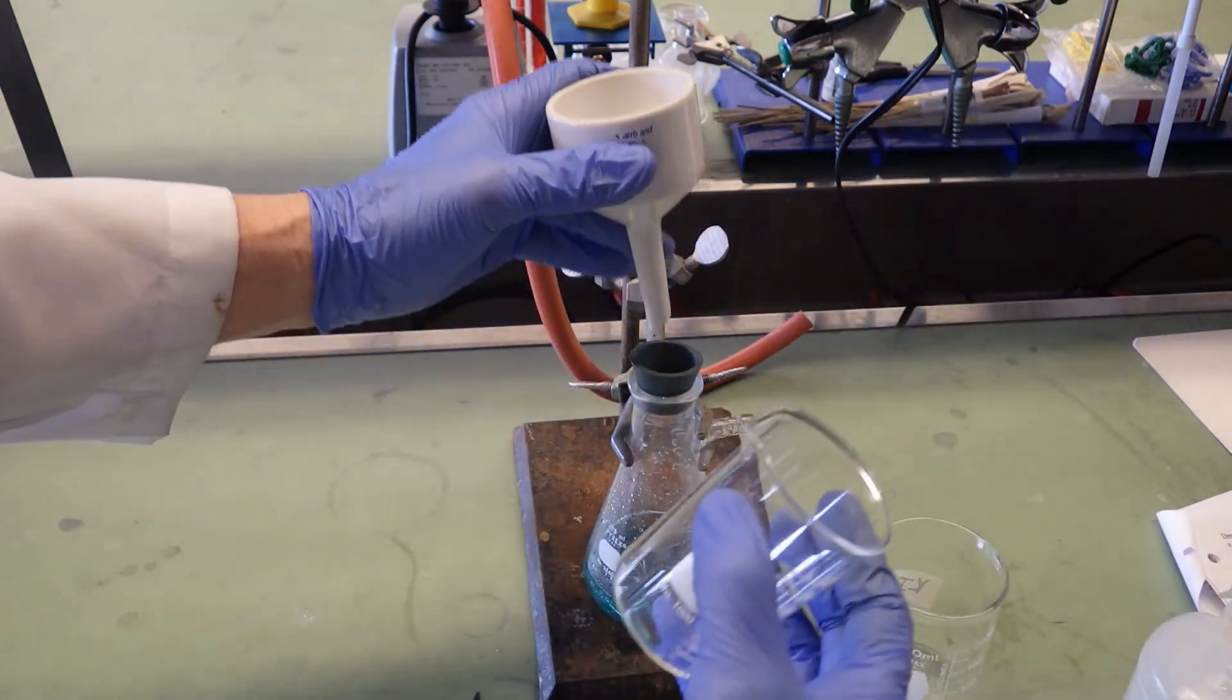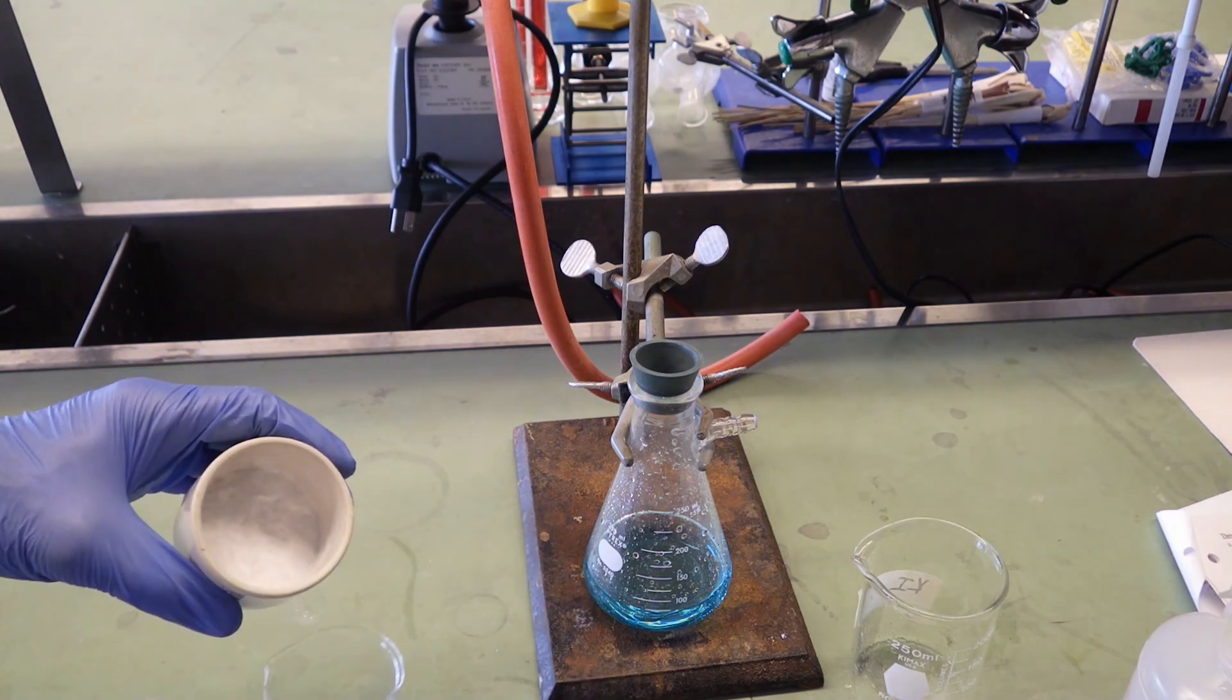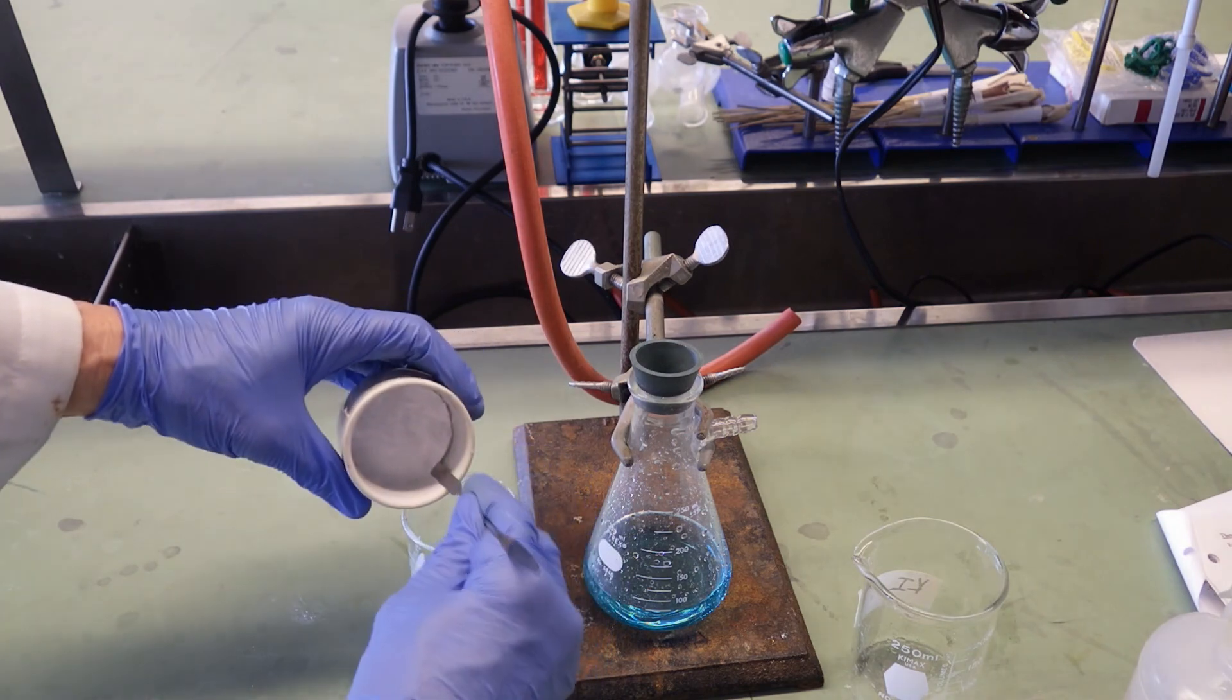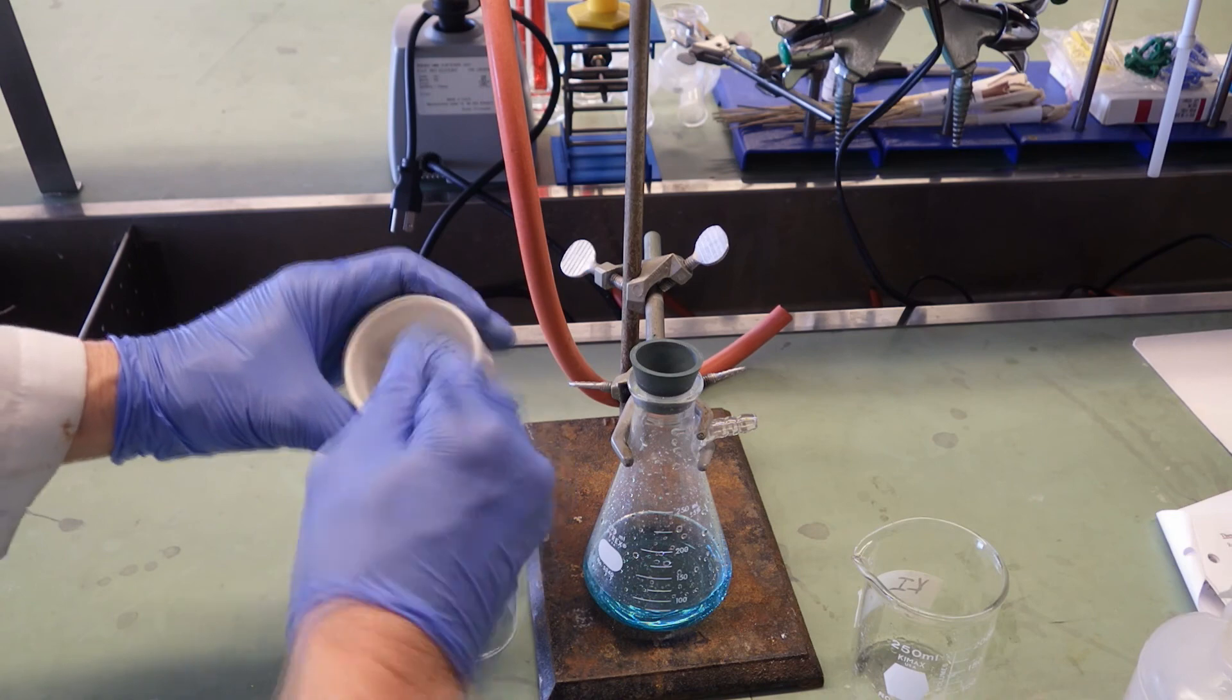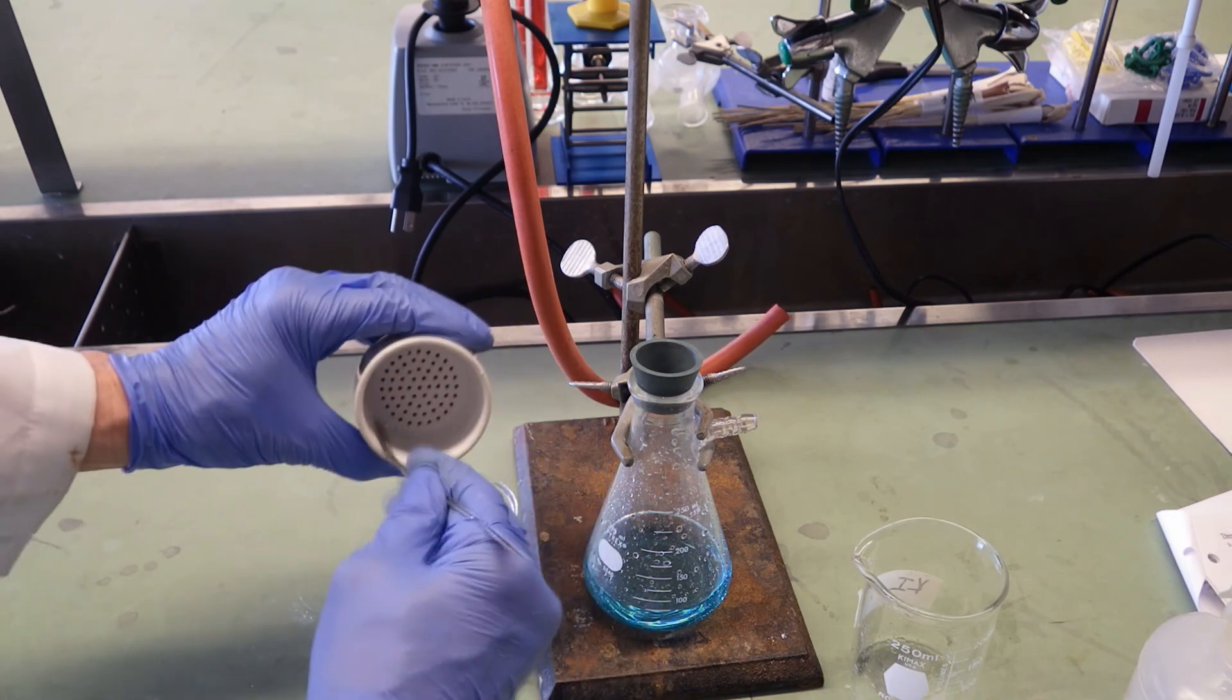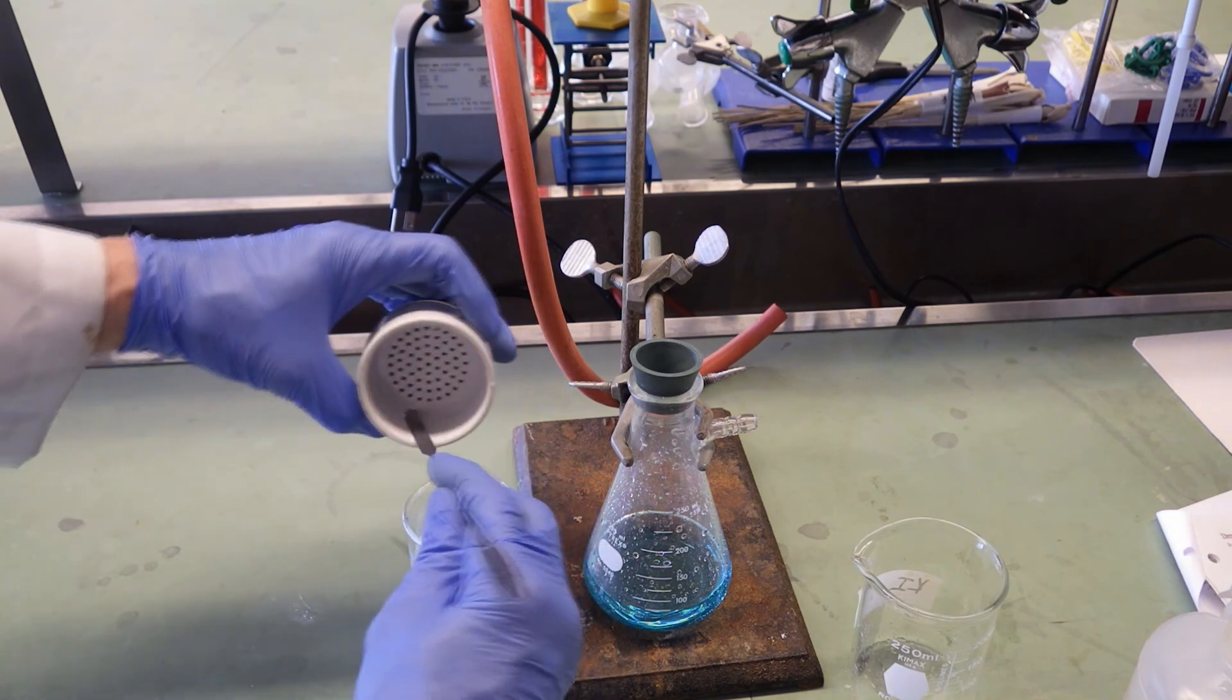Next we're going to quantitatively transfer—that means to transfer all of it—into the beaker that we weighed earlier. I'll speed this up a bit because it's tedious. All right, so we're going to let that air dry and we'll get a final mass on it tomorrow.